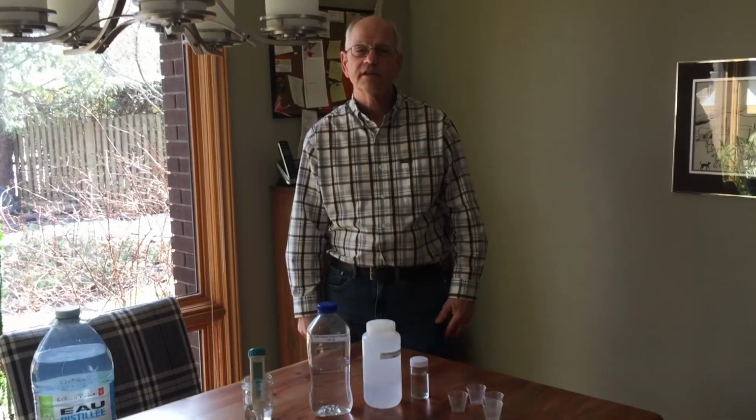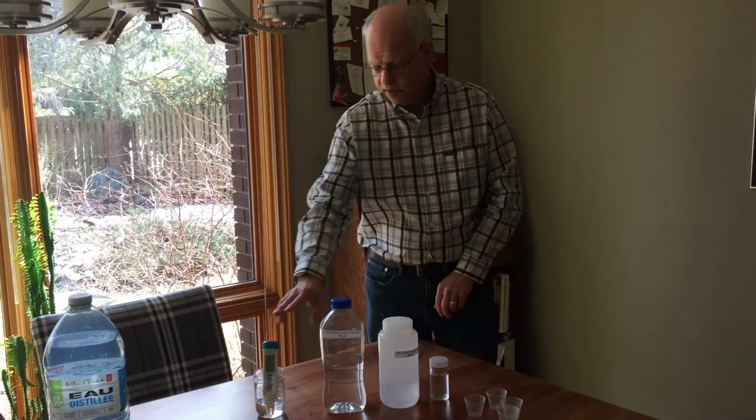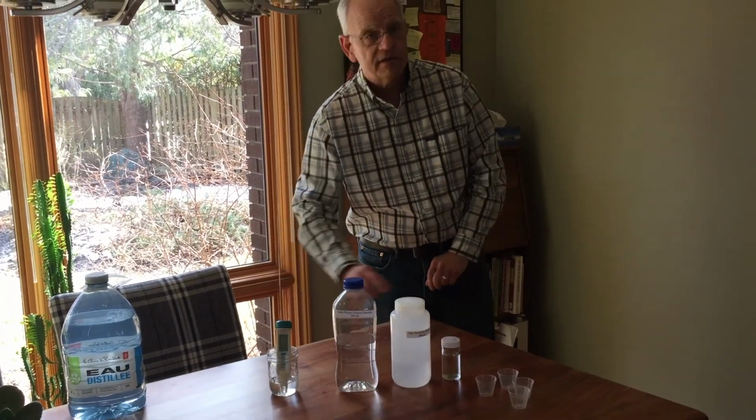We're meeting with Conrad today. Conrad, do you want to just do a quick introduction? Hello, my name is Conrad Gregoire. I'm a retired research scientist. I was a chemist for all of my life, an analytical chemist. And so I'm very used to doing these kinds of measurements. And this morning we're going to talk about the use of this handheld device for measuring conductivity in natural waters.